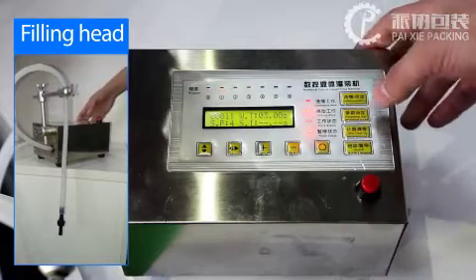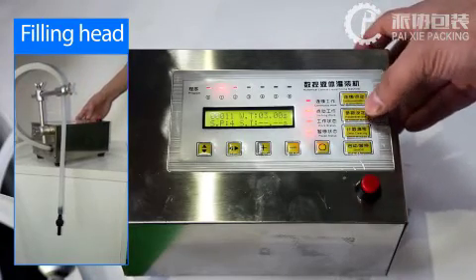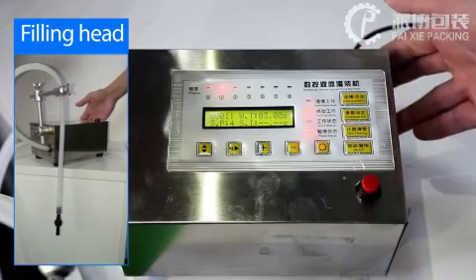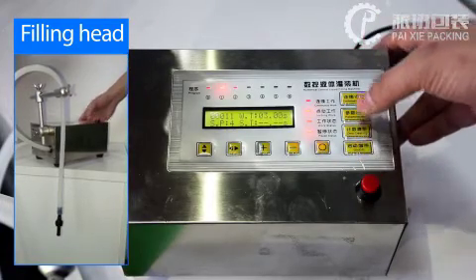Let's check the number four feeding speed and press the parameter setting button again.